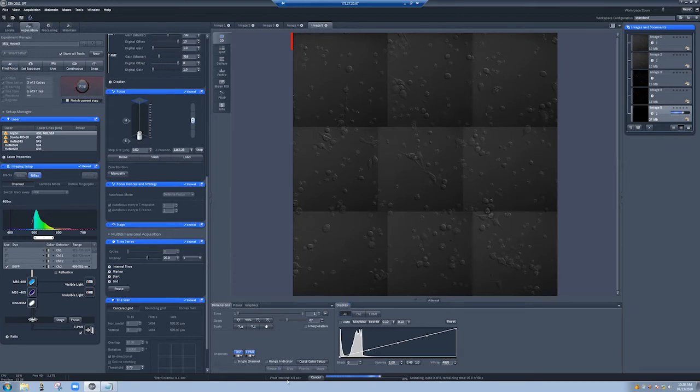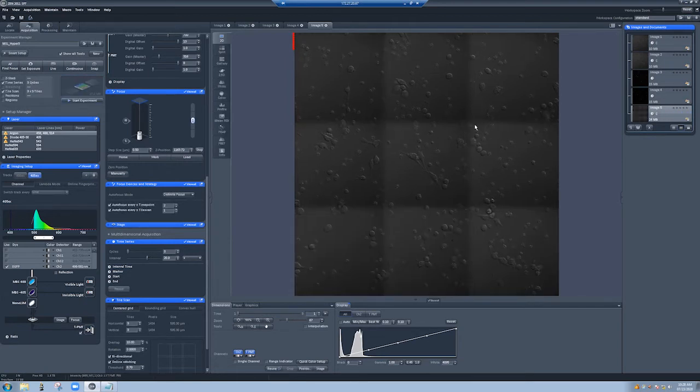You saw that, so that's at 7, 6, 5, four, three, two, one. So it took about 15 seconds to take the images. The reason you don't see much change here, well, actually there you saw a little bit of change. There's not much going on. I'm not really doing much. And you see a little bit of drift. The reason you see the shading, this is typical in DIC, so you shouldn't worry about that. It's not easy to correct for that. This is more illustrative of how you can do multiple positions with tile scan.